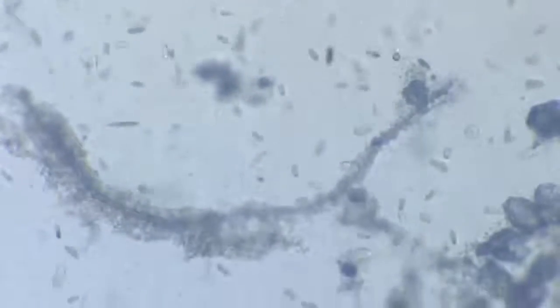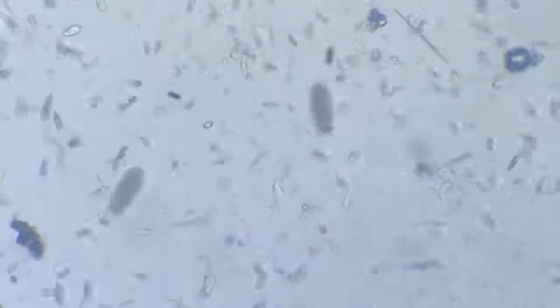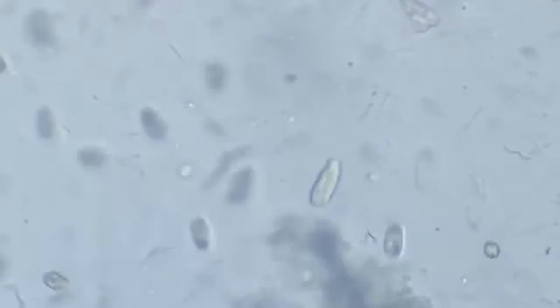There were a few rotifers also on the wings. If we go there, I had noticed a rotifer on the wings. Let me bring that in focus. And there are a lot of bacteria in the background. Let me try to grab a view of that. I believe you can see those bacteria, those black lines. There are more here.